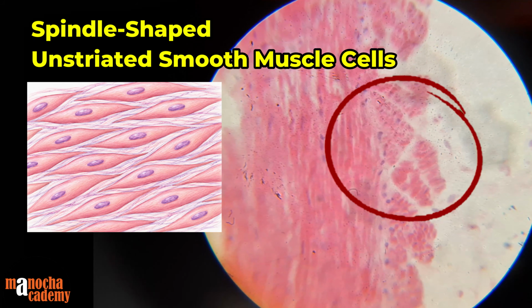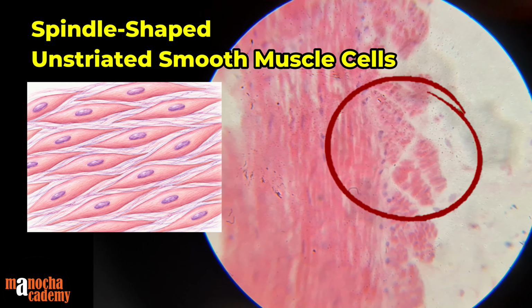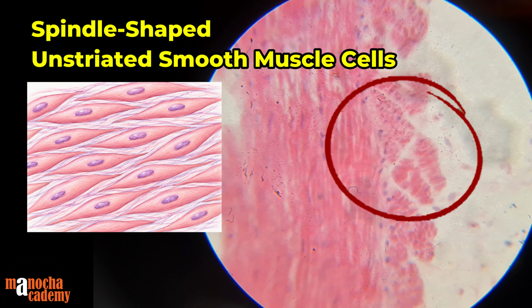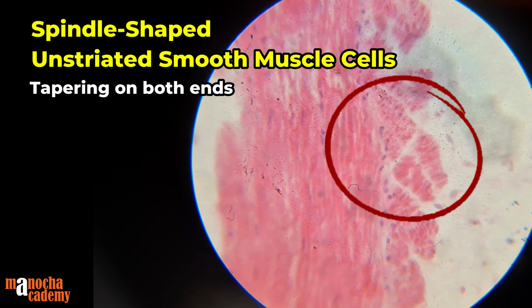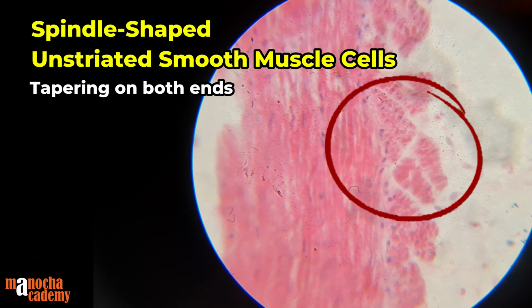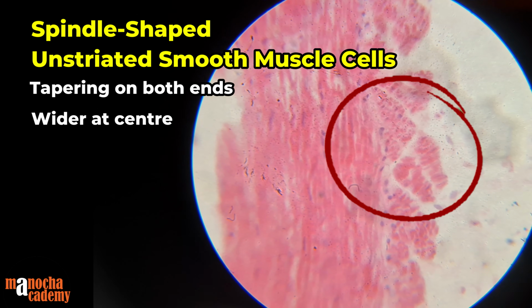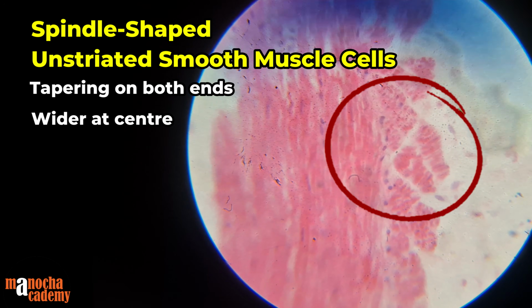Next we have unstriated muscle, which is also known as smooth muscle, and as you can see from the strips, the smooth muscles are elongated in shape, right? But the elongation has a specific shape, that is, it is tapering on both ends, as you can see, and it is wider at the center. So this kind of shape is known as a spindle shape, where the ends are tapering and the central part is wider than the two ends.